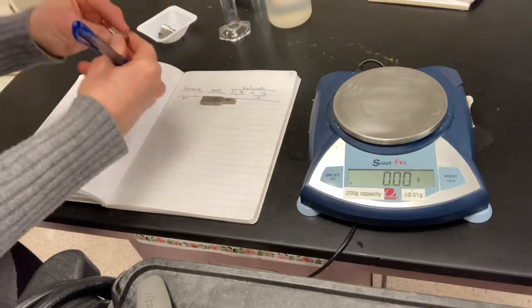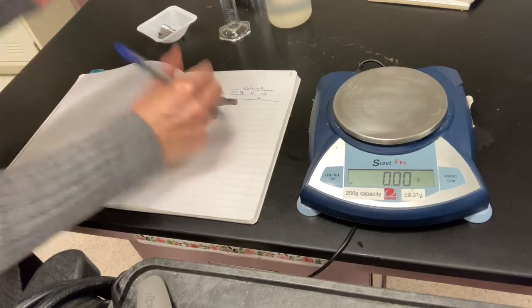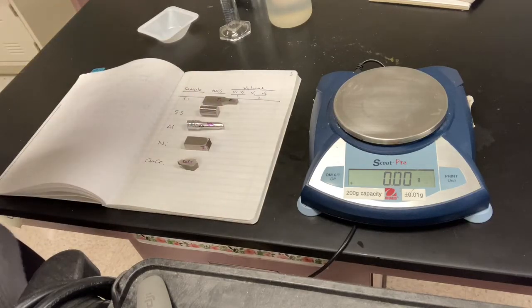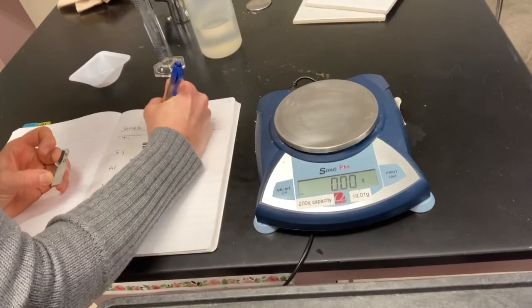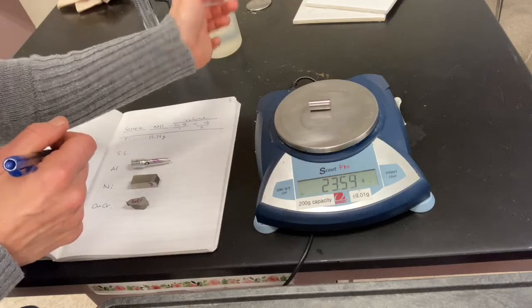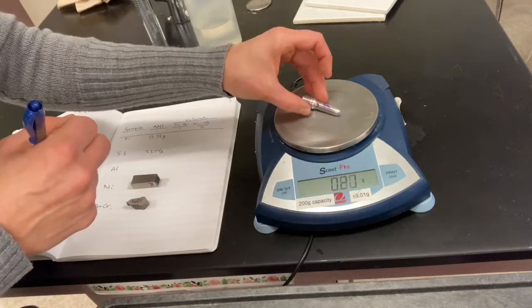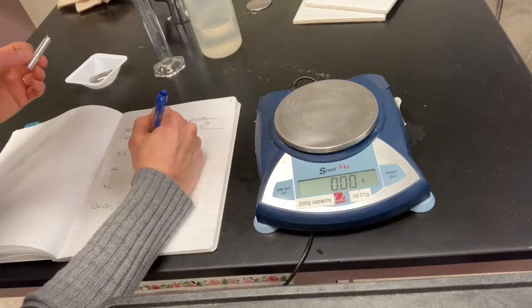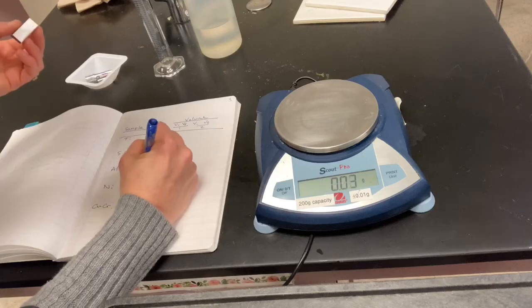We are also going to use some stainless steel. Some aluminum will find its way in there as well. We're also using nickel and a copper chromium alloy for the second part of the lab. So please go ahead and be filling in your data as you go. Again, you can skip ahead and just fill in the data table if you'd like, but I am trying to let you see all of the data collection happening live and in person.